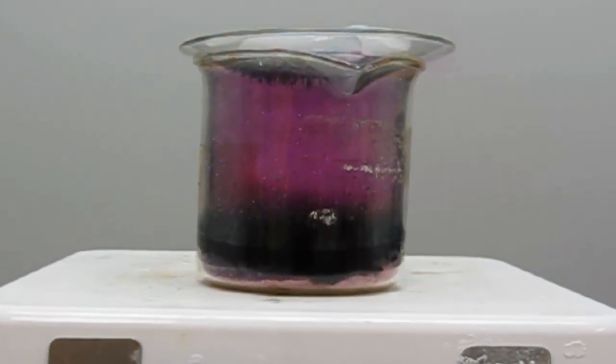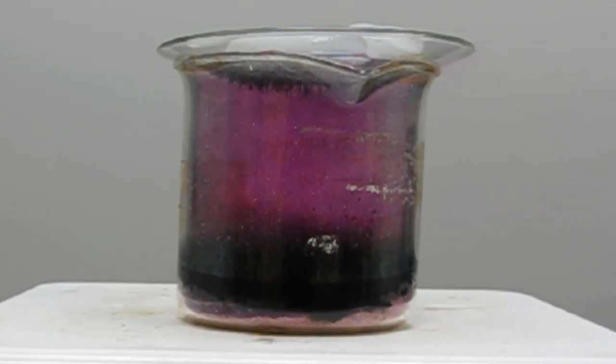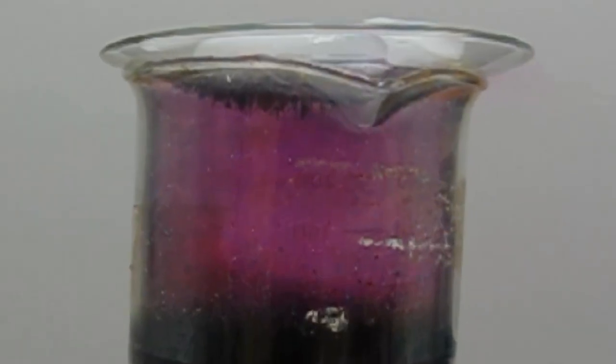So after a while, the crystals will have formed on the bottom of that glass, and you can see them here sort of dangling down from the watch glass.